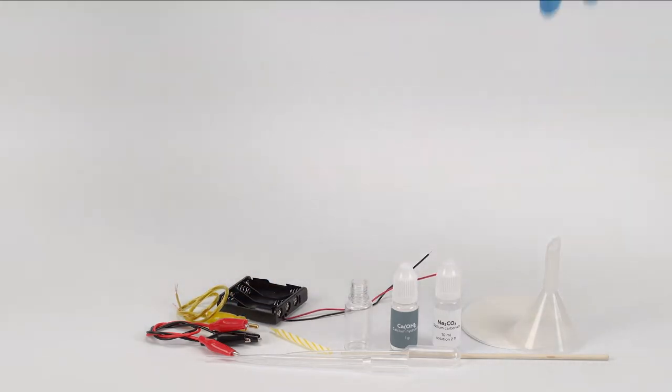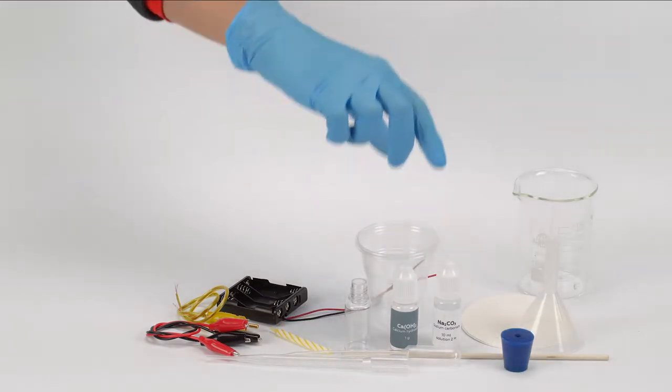Take the funnel, the rubber stopper with one hole, the beaker, and two plastic cups from the starter kit.